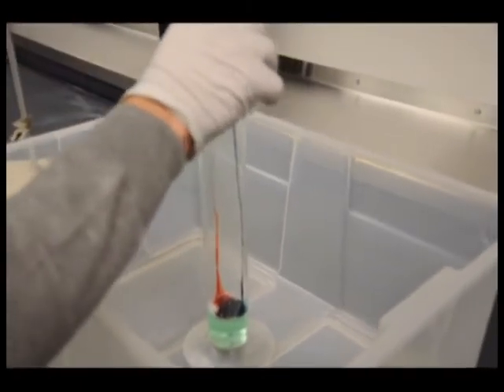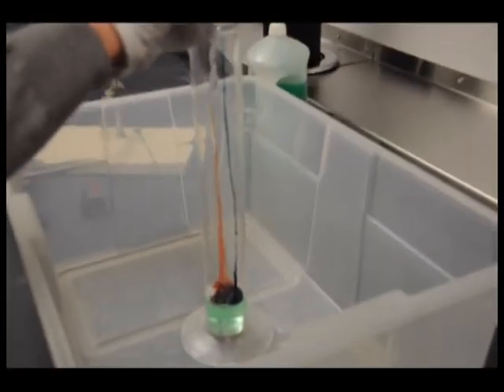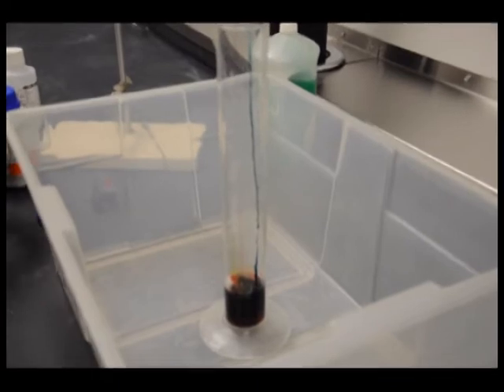Add 10 milliliters of saturated potassium iodide solution, swirl to mix, and stand back.